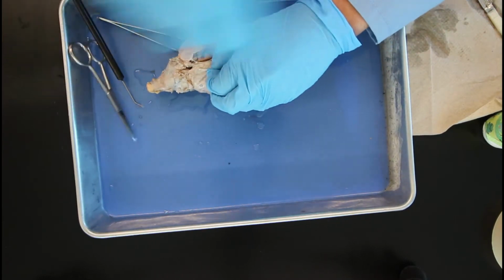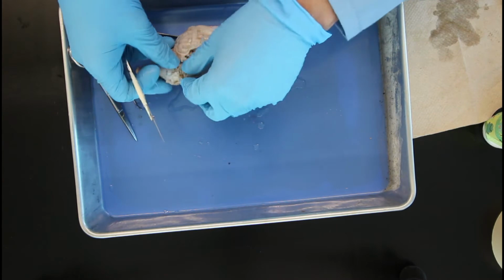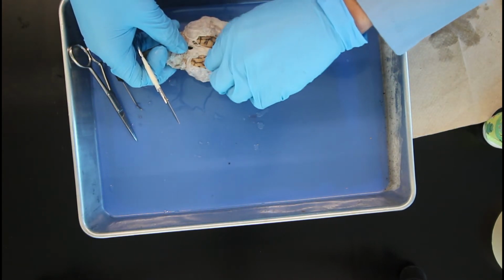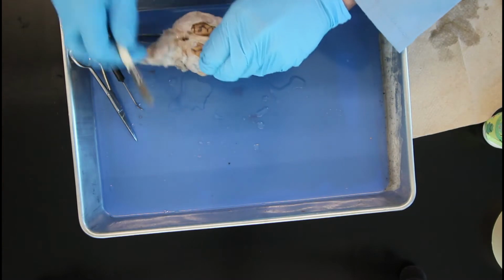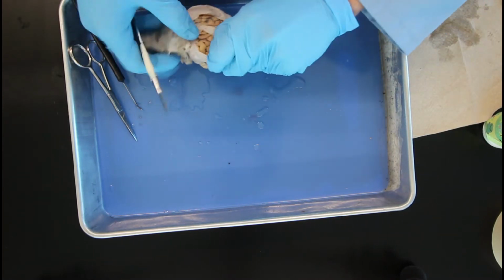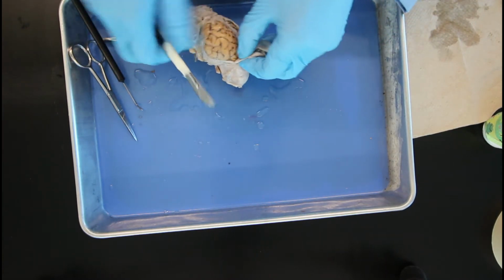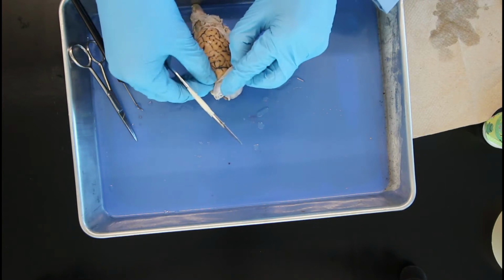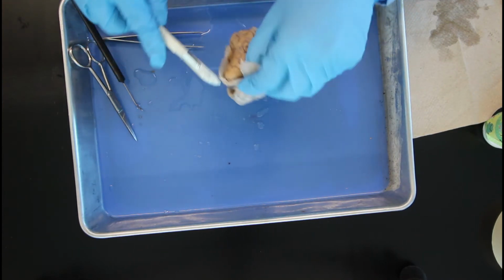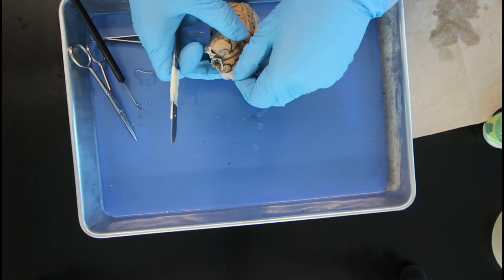But right below that layer is known as the arachnoid mater. It's kind of got a spider web type of look to it. It's a little more vascular, and this allows for more connections to occur throughout the brain. And right below that, there's a thin little layer that you might not be able to see too well from this video, but that's known as the pia mater, or the soft membrane layer of the meninges.